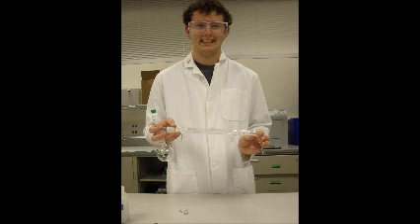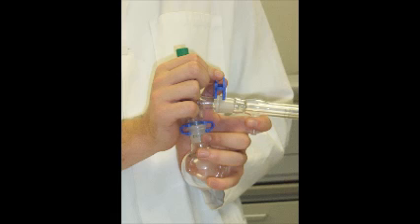Now, we will attach the still receiver to the opposite end of the condenser. With each of these joints, it is imperative to use properly sized glassware clips to keep the apparatus from falling apart during the experiment.